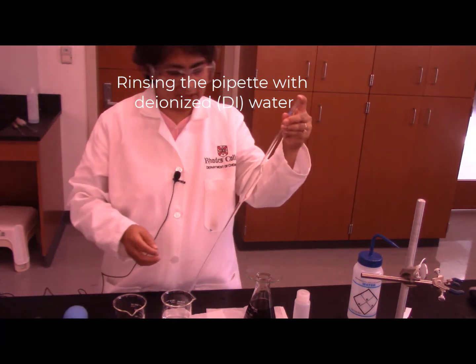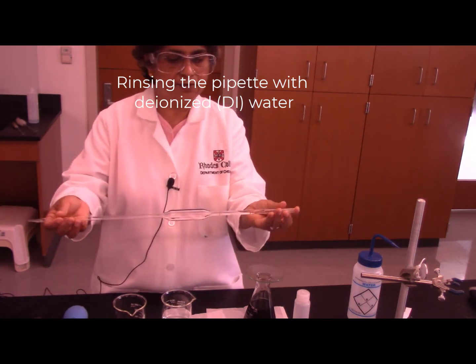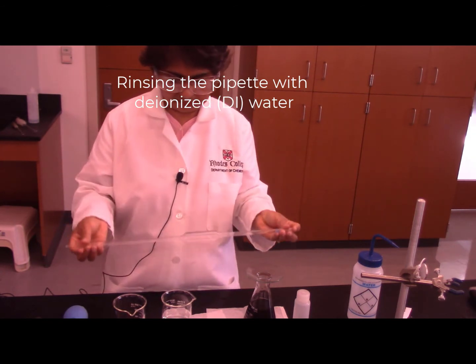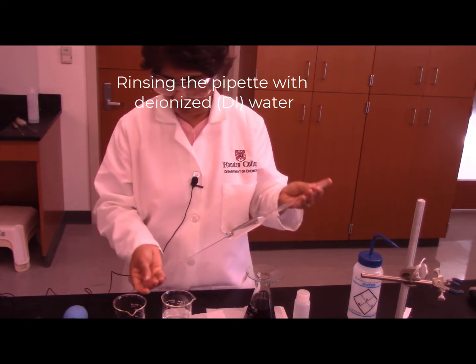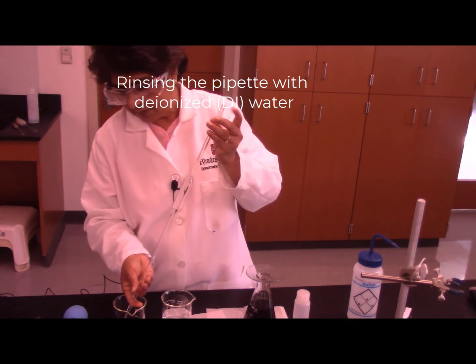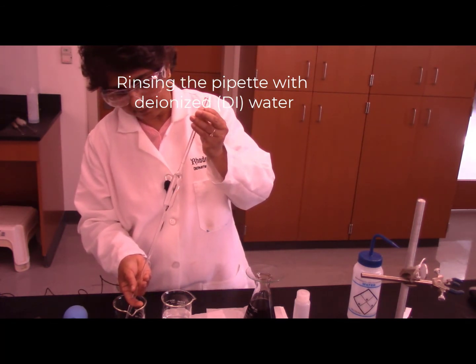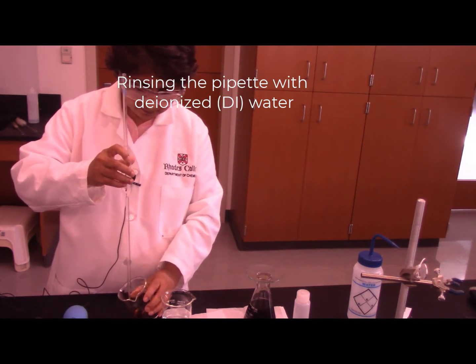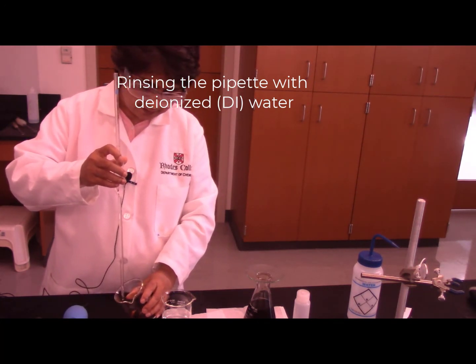Now I have enough water inside the pipette. Now I roll the pipette by the ends of the pipette, and now I am draining the water into the waste beaker. Usually draining is faster if we do it along the sides of the beaker.